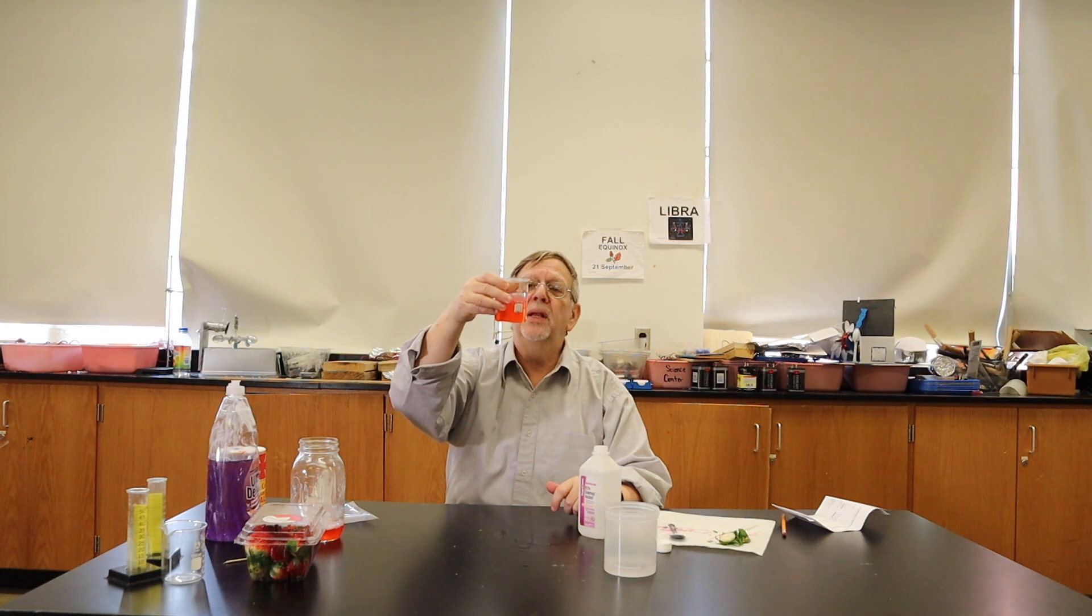DNA all by itself is not very impressive. I can actually see it now. There is a layer that looks like clumpy little sticky stuff. And that is what we are going to pull out.